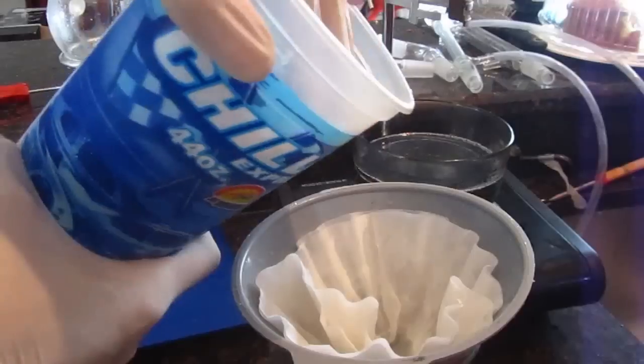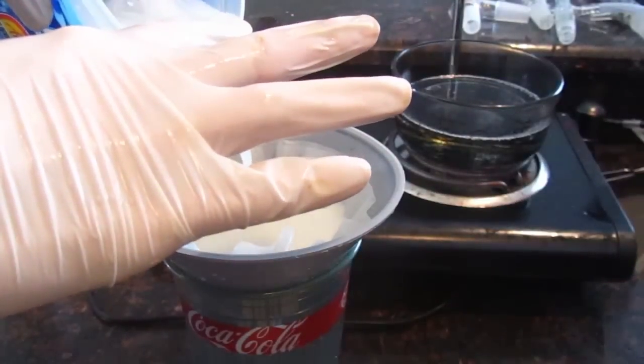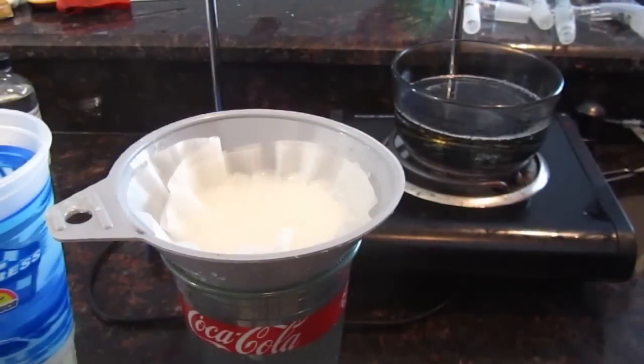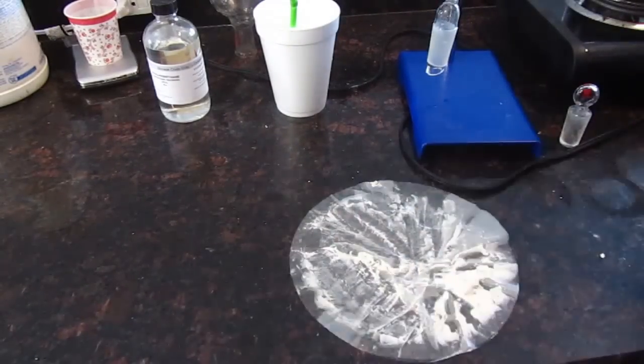And here we're crashing out the solution into ice water. This is soluble in water at about one gram per 100 milliliters, but in ice water, it's insoluble. But all the salts, like sodium sulfate, are still soluble.